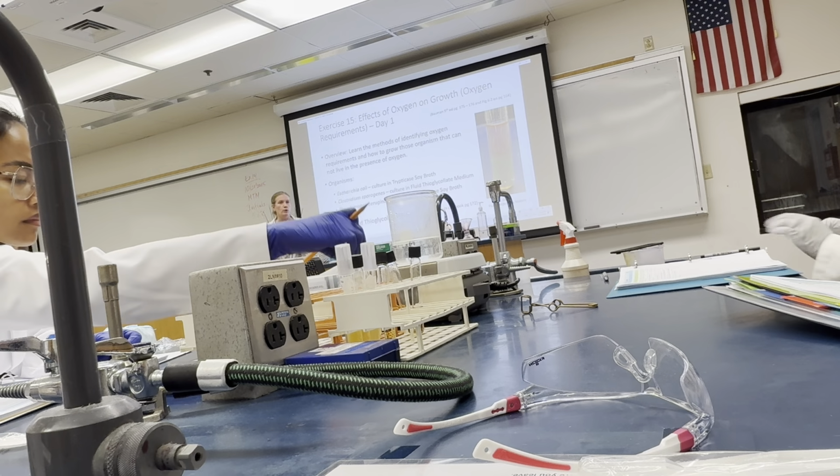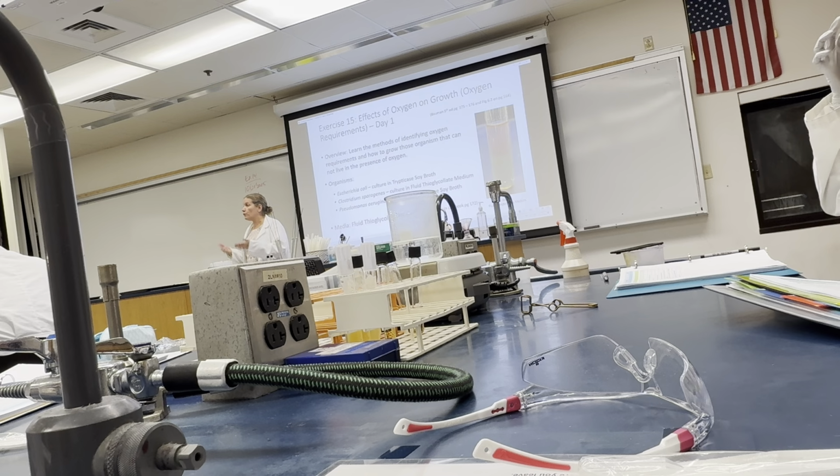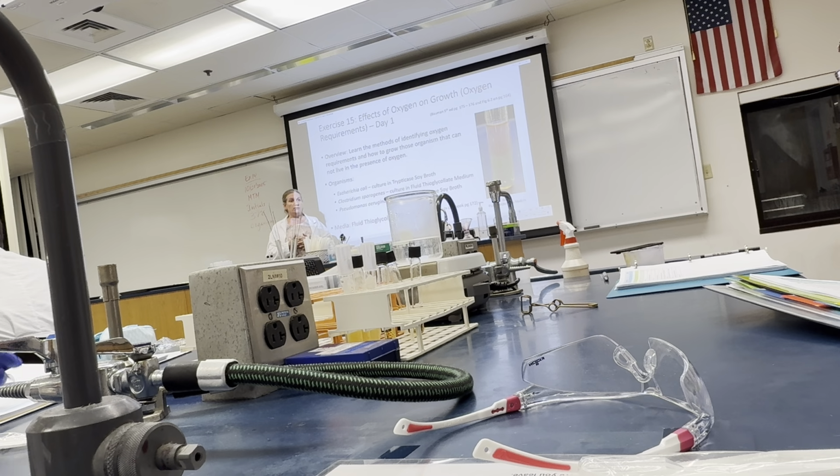Why are you boiling it? When you boil liquid, you're forcing out oxygen. So we boil it to force out the oxygen. I might ask that question: why would you boil it? To remove oxygen.